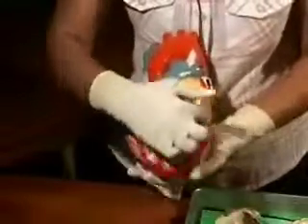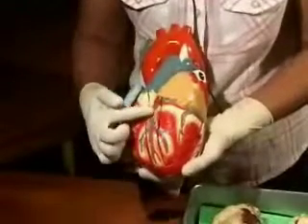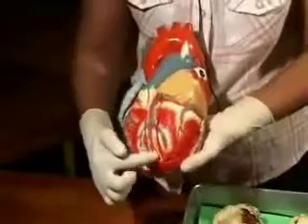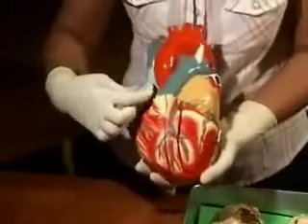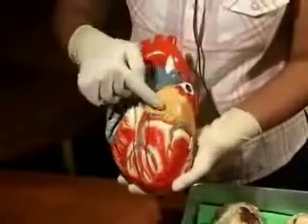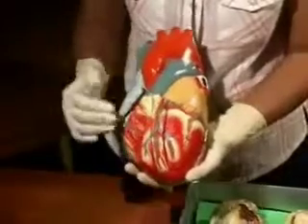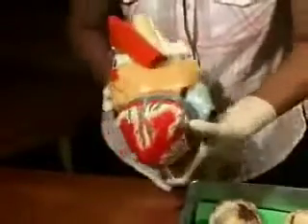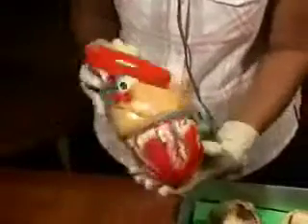This is the left ventricle, separated by the interventricular sulcus, where you see these blood vessels. In fact, they are indicative of where the sulcus lies. This is the auricle of the right atrium. This is the left atrium, and this is the auricle of the left atrium. Only a little bit of the auricle shows on the anterior surface. Most of the left atrium is present on the posterior surface, as you can see here.